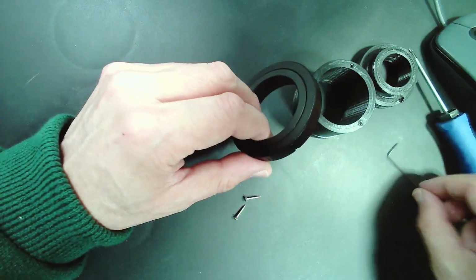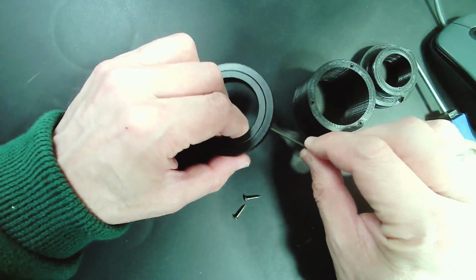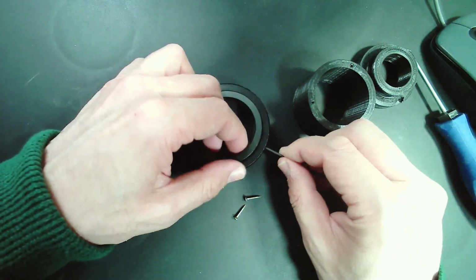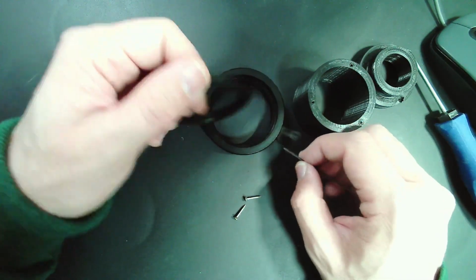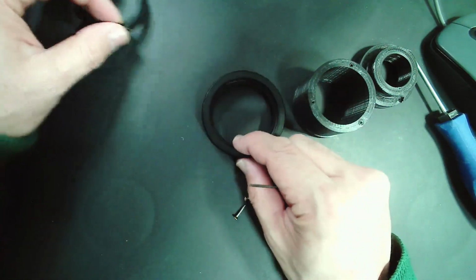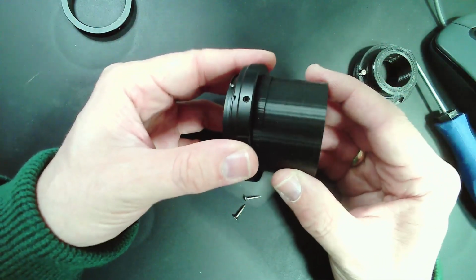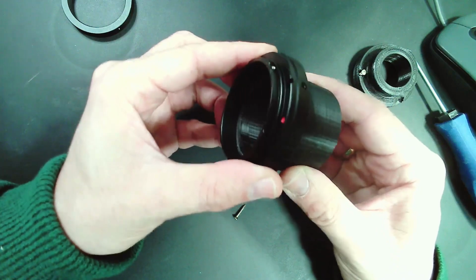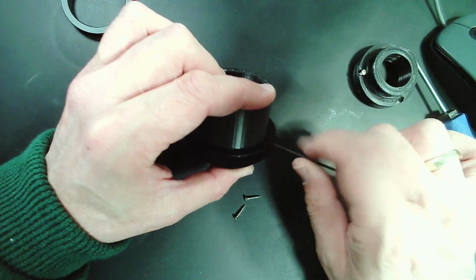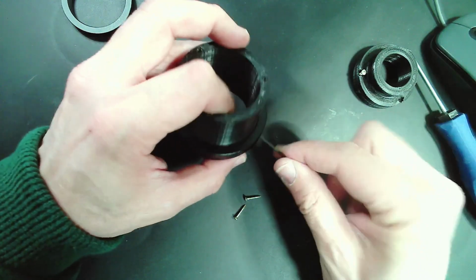So what you do now is the following: you take a little tool here, and you loosen the three screws to remove this inside ring here. Okay, I don't need that, because there's a threading here which is not needed, and then I'm able to directly connect this part over here to the tube. And then all you have to do is tighten it again, and we're ready to go. Okay, so here the three screws, and that's it.